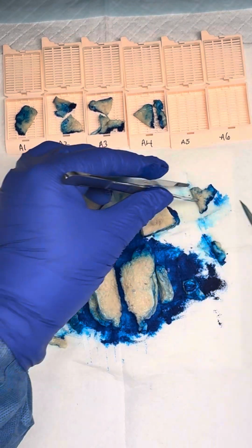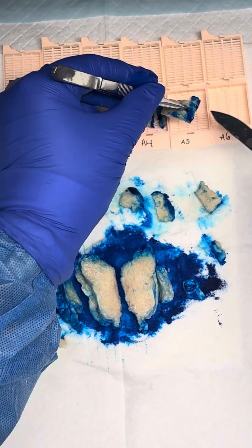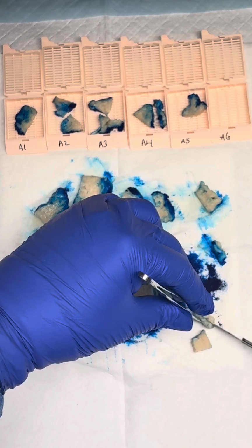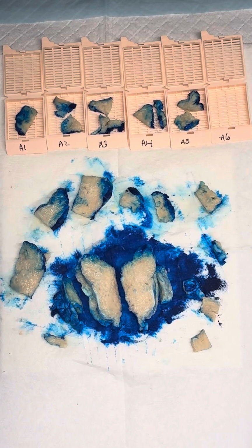If we start getting into invasion for our thymomas, then we are starting to get into that upstage criteria. So for our T2s, it could be 3 centimeters, but if we have involvement of the lung, we're automatically going to be upstaged. Some other things that our T2 category could involve would be our pericardium or the phrenic nerve. And when we start getting into our T3 and our T4, we're getting to our more extensive involvement with our superior vena cava, our pulmonary arteries, the chest wall, the aorta, so on and so forth.